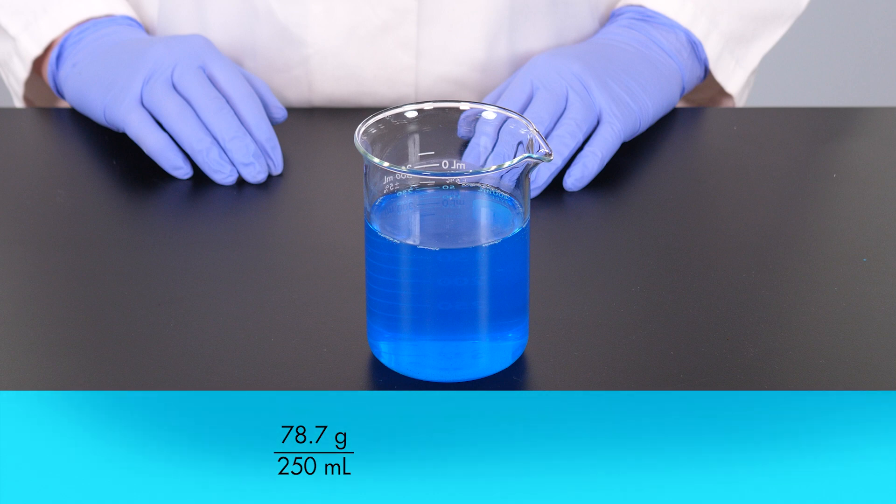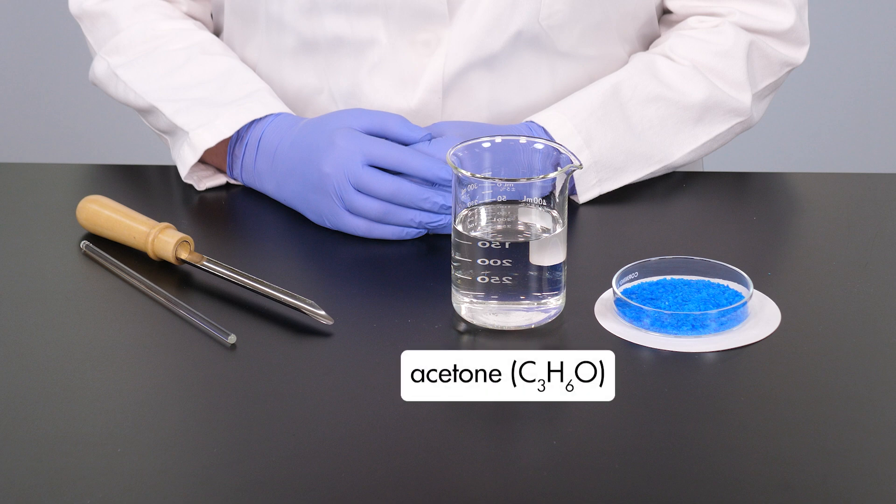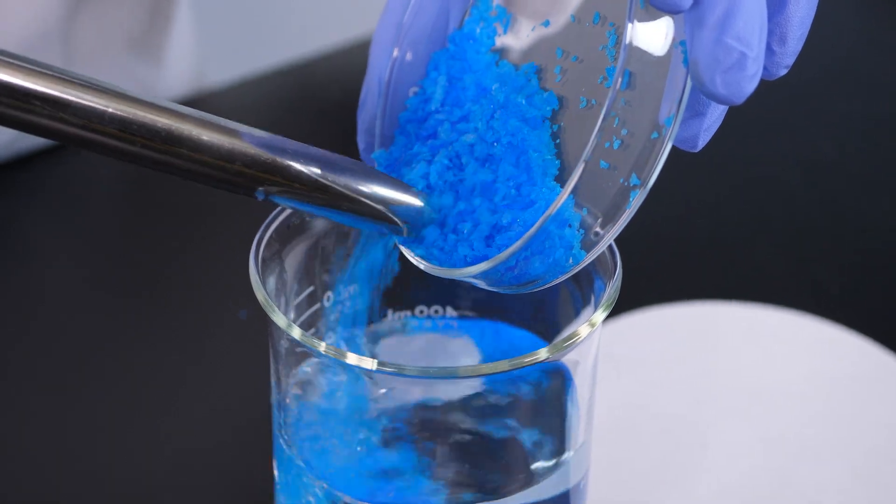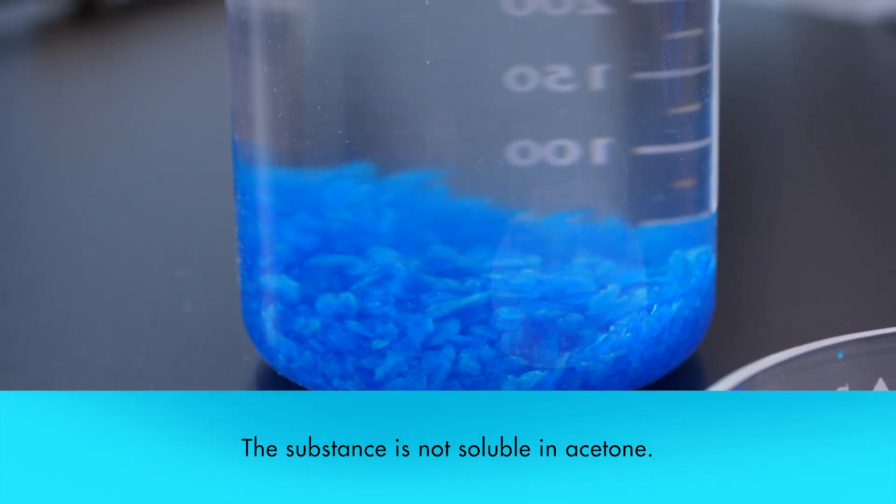We discover that the maximum amount of solute that dissolves in 250 milliliters of water is 78.7 grams. This means that the solubility of the substance in water is 314.8 grams per liter. We also try to dissolve the substance in an organic solvent, such as acetone. After adding the solute to the solvent and stirring, we conclude that the substance is not soluble in acetone.